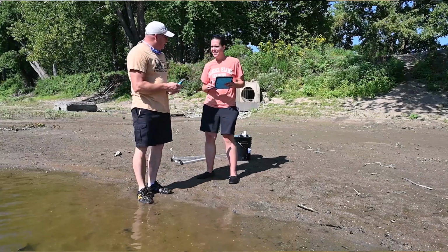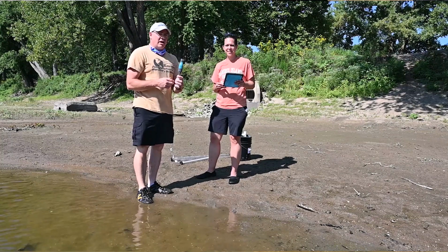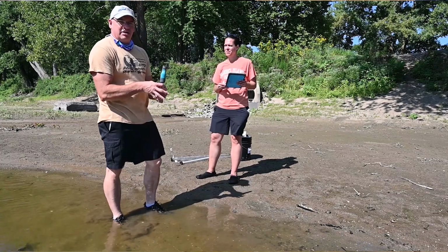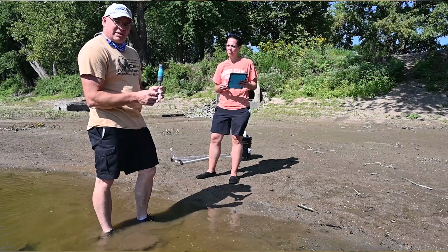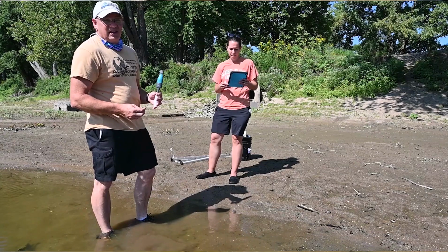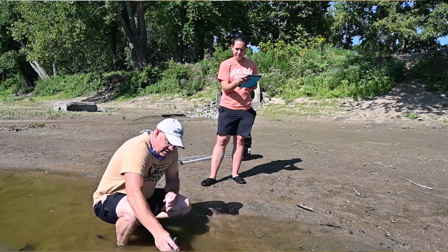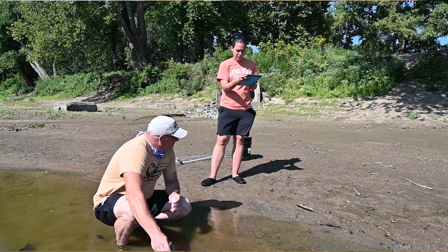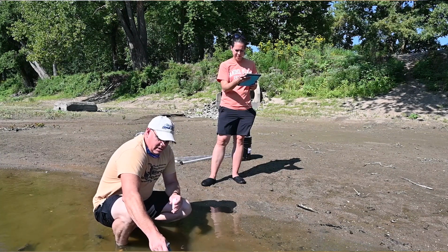All right, we have our dissolved oxygen set up, right? And we've already talked about what dissolved oxygen is. We're using these wireless ProbeWare probes, something we happened to purchase and are using for some of our work. Rather than doing the chemical wet test, this is just a lot faster and easier. To do that, we just dip our probe in, and Sarah has the app on the iPad, so she will get our reading.